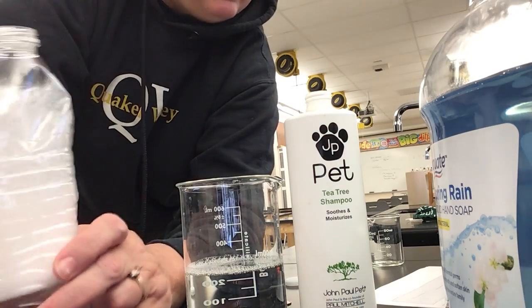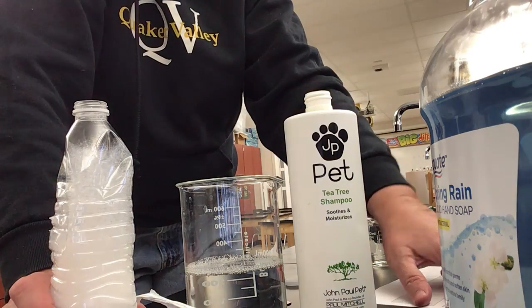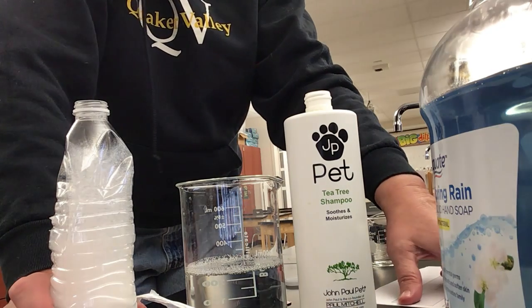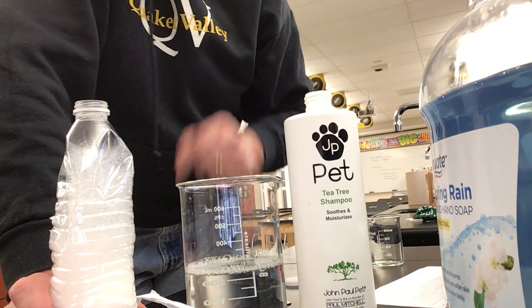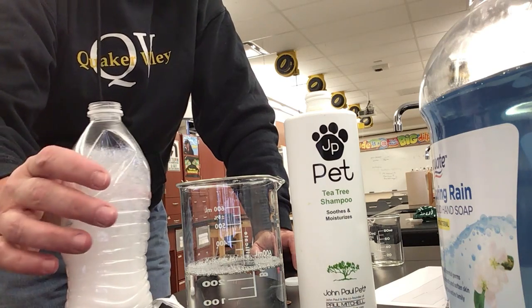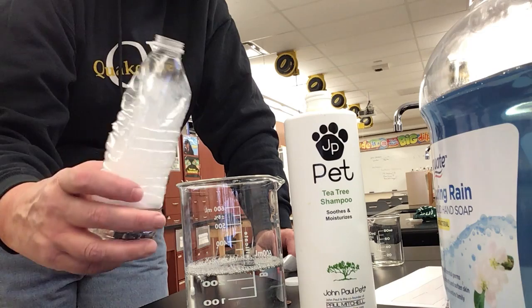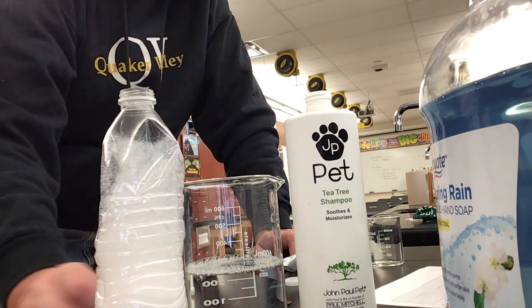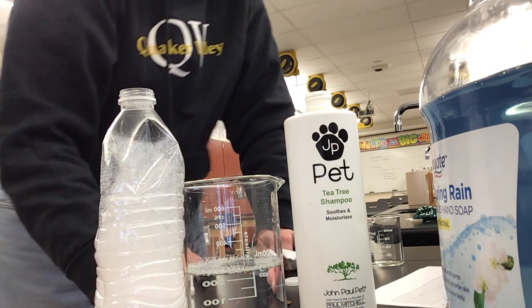So you would record that. Observation-wise, there's not a box for it there, but if you're using my data, I would say ignore the airy bubbles at the top. You've got some space there on the side. There's no box for it, but I would put that. And really, like I said, the reason I did that partly is because I was taking the label off and I squished those bubbles back up. So I'm just focusing on the thick foam, which is what existed the first time.